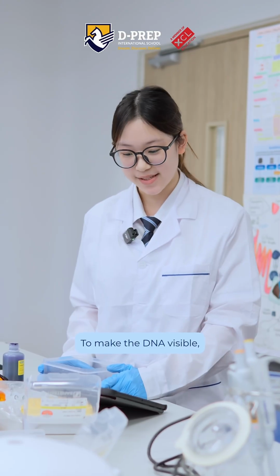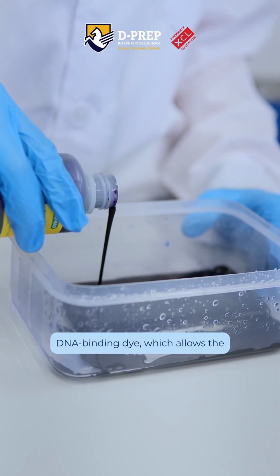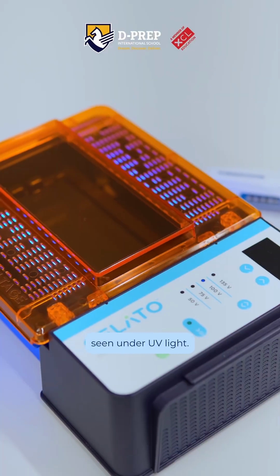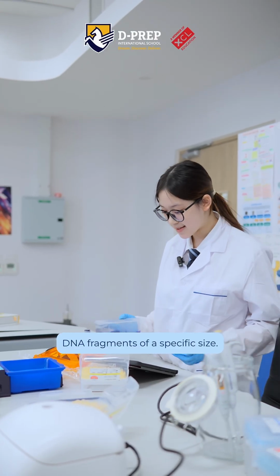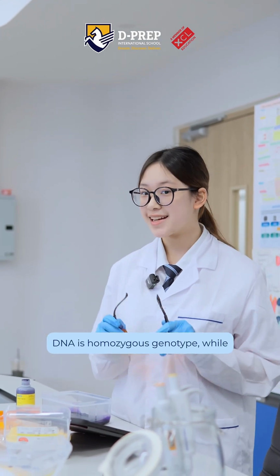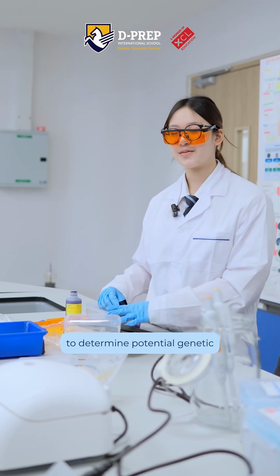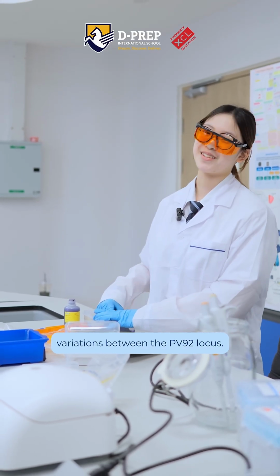To make the DNA visible, we stain the gel with a DNA binding dye, which allows the fragments to be seen under UV light. Each visible band represents DNA fragments of a specific size. One band might indicate that the DNA is homozygous, while two bands may indicate heterozygosity. These patterns allow us to determine potential genetic variations at the PV92 locus.